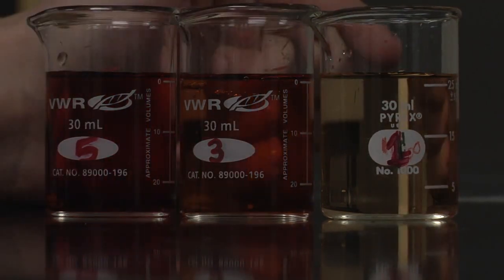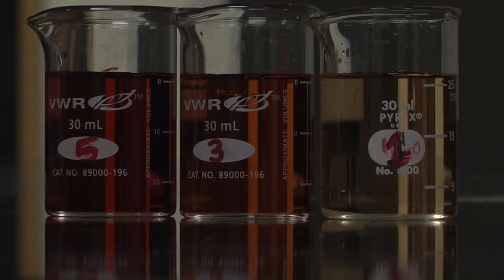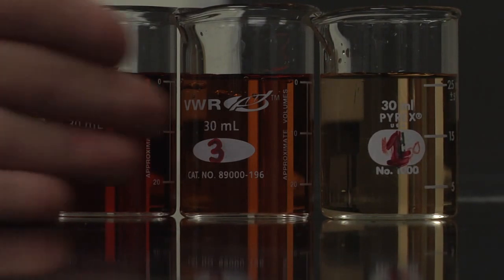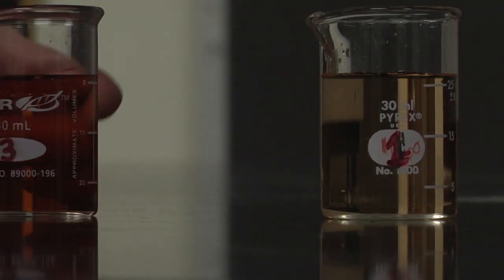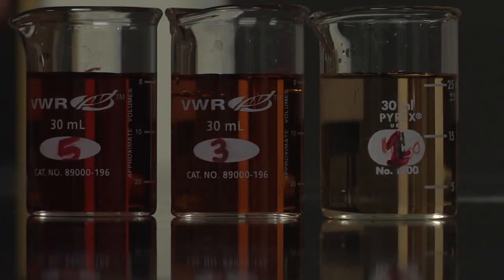Here you can see that by varying the concentration of iron, the color has changed, so the amount of complex ion has also changed. For table one, you should always be going from a dark red to a light yellow. When you're working for table two, it should be a light orange-yellow to clear.